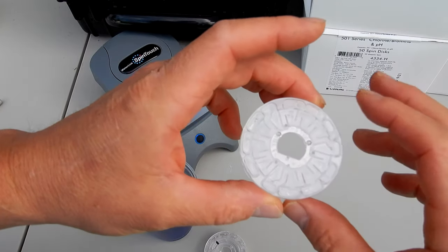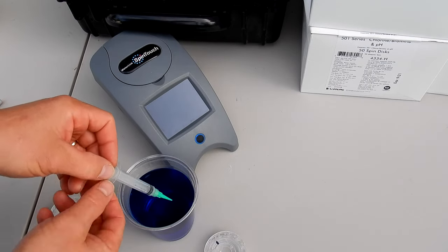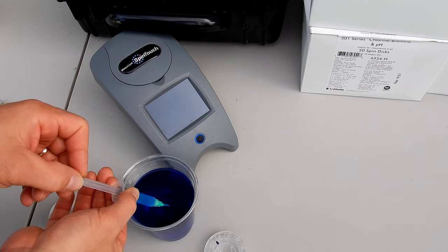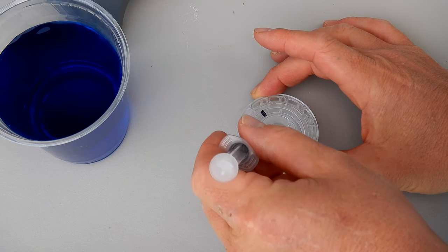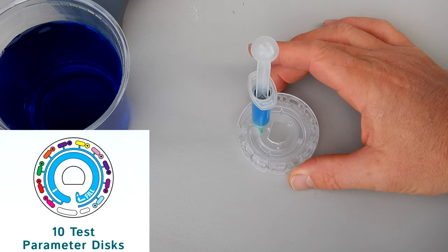The three-use disc is a little trickier — I'll show you how to properly fill it. I'm using food coloring here so you get an idea of exactly how the chamber should be filled. You want to insert the syringe and then pull back fully so it's totally full of water. The disc should be on a flat surface, then go ahead and insert the syringe — if inserted correctly it should stand up by itself.